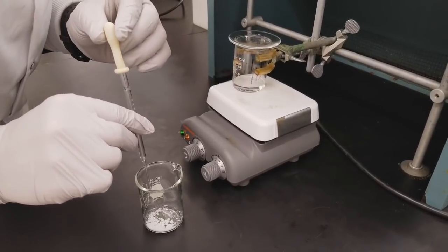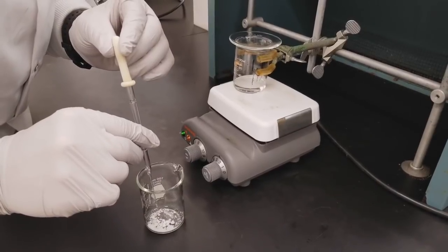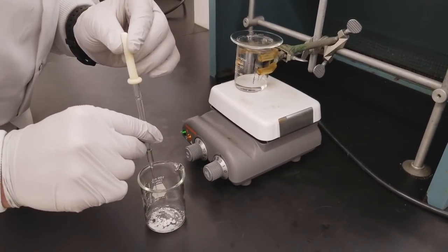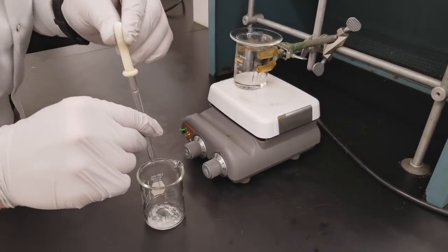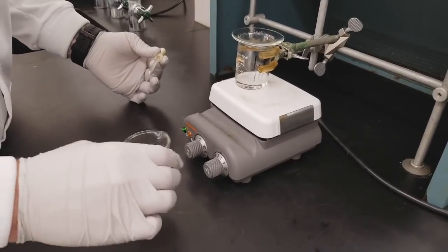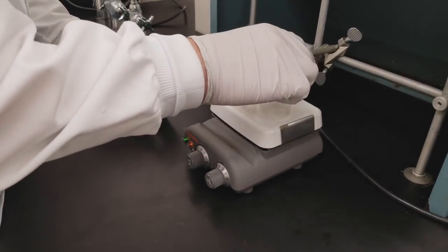It's important that we don't heat the solid without any solvent. If we were to put it on the hot plate with no solvent in there, it could potentially burn. So we just want to add about one milliliter. Swirl it around and then we can put it back onto the hot plate.